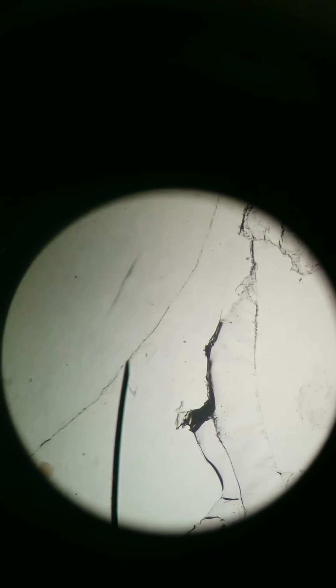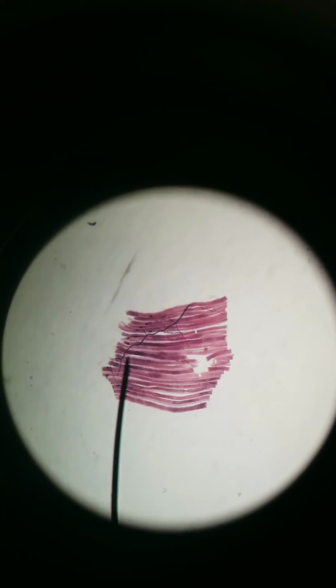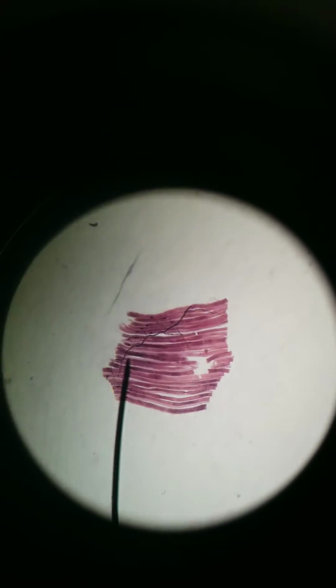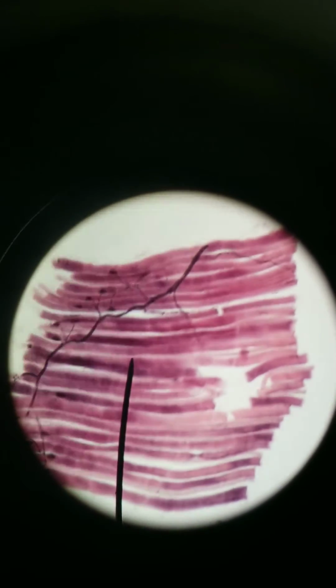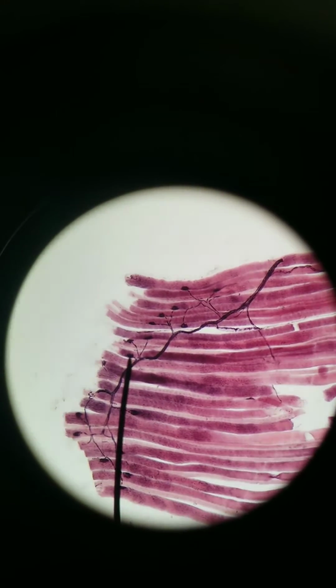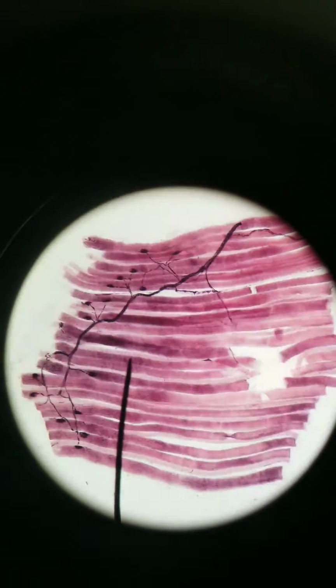One more receptor that I want to go over here. This is not in the skin. This is actually in muscle. It's called a muscle spindle. Right now what we're looking at is a longitudinal cut of skeletal muscle, and you can see the staining for a neuron with its nerve endings. So this is really the end of a neuron. You can see the long branch and all these axon terminals in these dark circles. Those are the axon terminals, so these are neuromuscular junctions. We're looking at a motor unit.